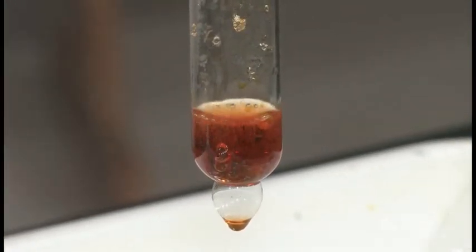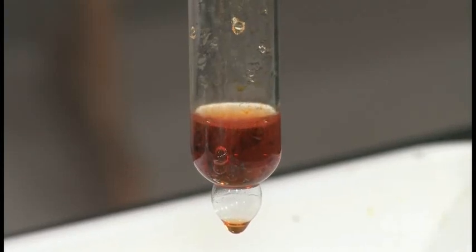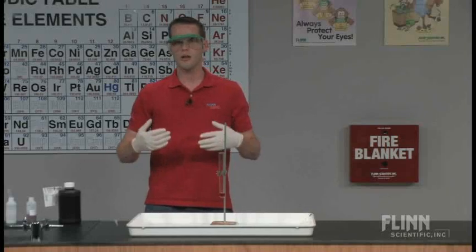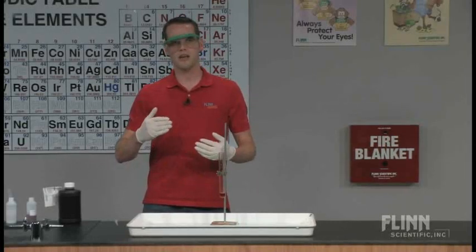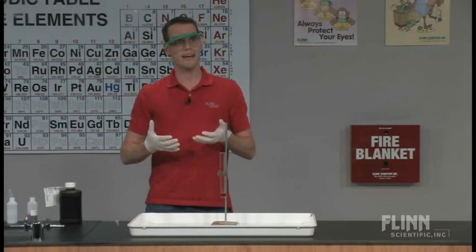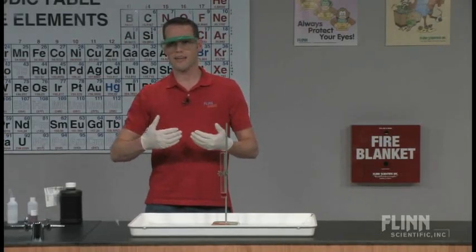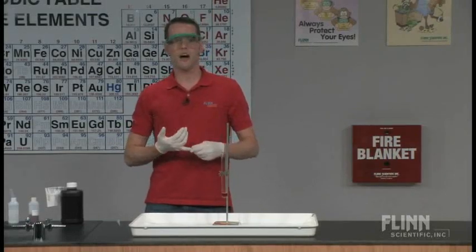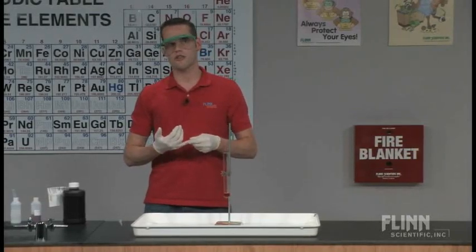And you can do this multiple times and show kids that a catalyst keeps being reused. So while this is handy if you're going to speed up a reaction for a commercial or an industrial process, you want something that's going to be reusable. You're going to consume less stuff. And so if you have a catalyst, you don't have to keep putting new stuff in there.